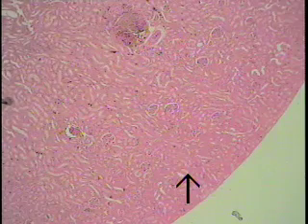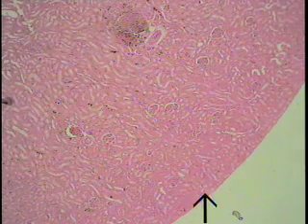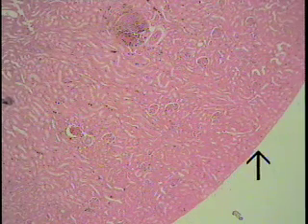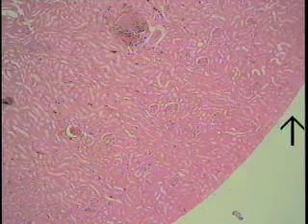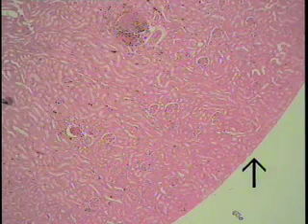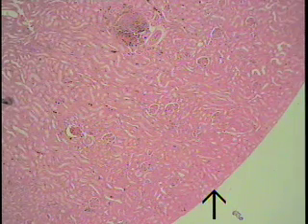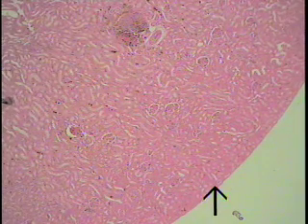If there were a renal capsule — and we'll go down in a moment and look — it should be located here: a thin connective tissue, tough capsule that surrounds and limits the kidney itself.